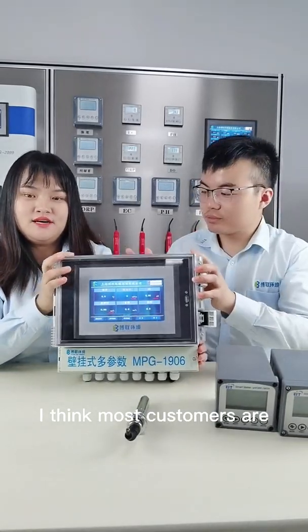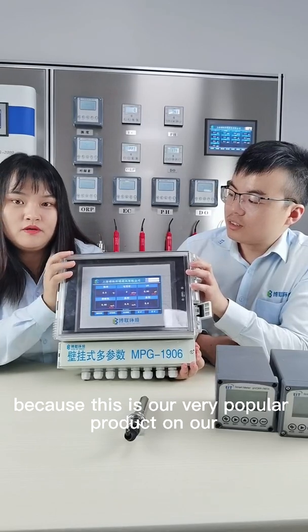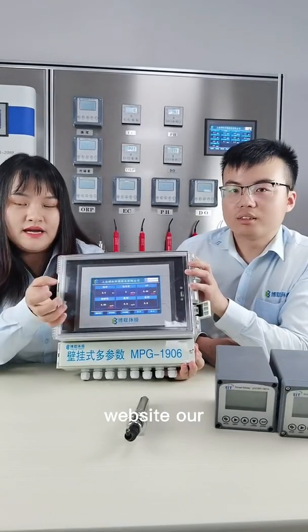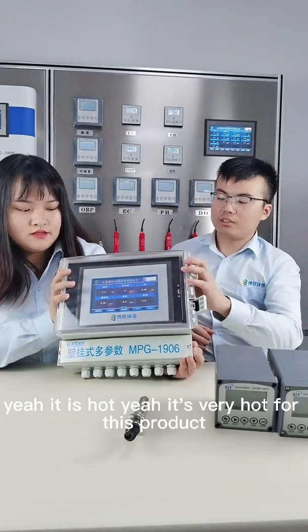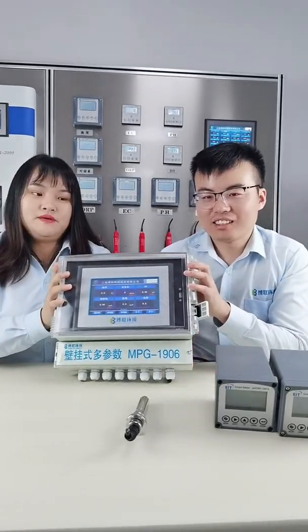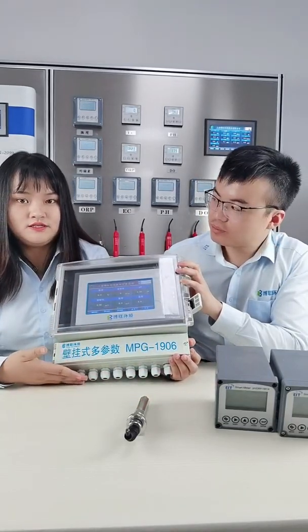I think most customers are very similar for this product, because this is our very popular product on our website, our Alibaba platform. This is a multi-parameter controller. You can see the connector which can connect the different digital sensors.